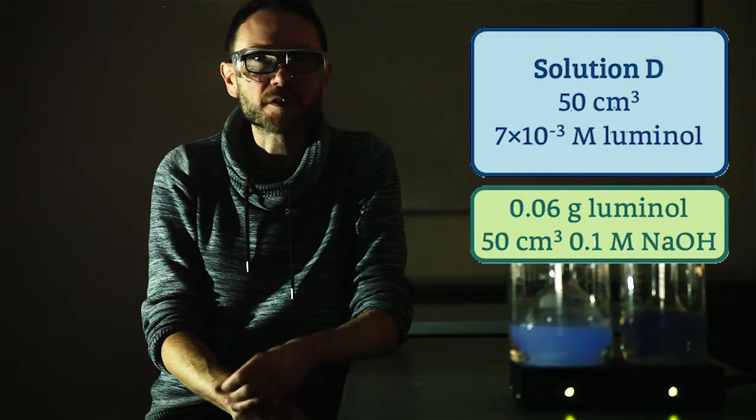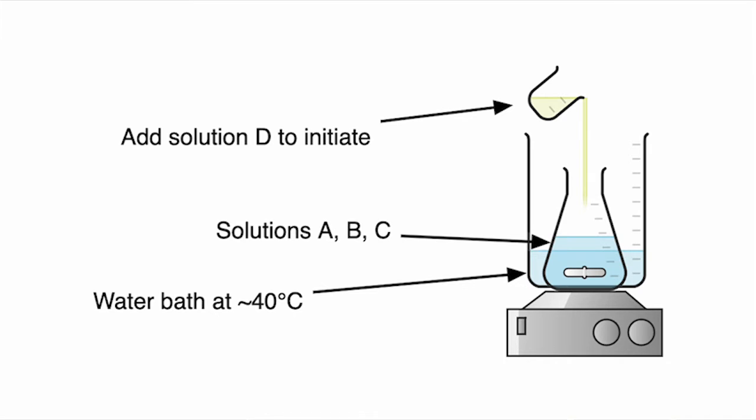Now, you need to think about how you want to show the reaction. All you need to do to start it is add solutions A to D in that order in a suitable container with stirring.